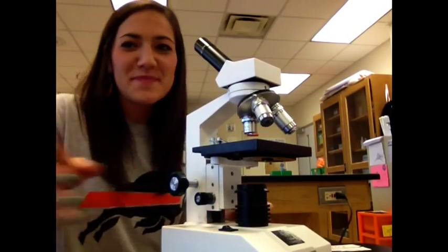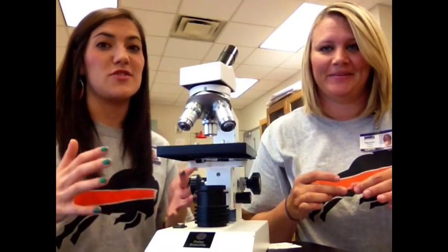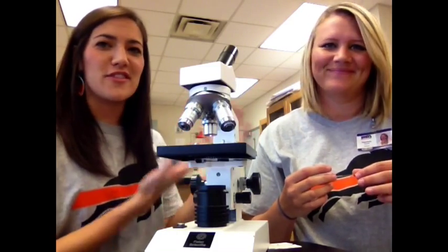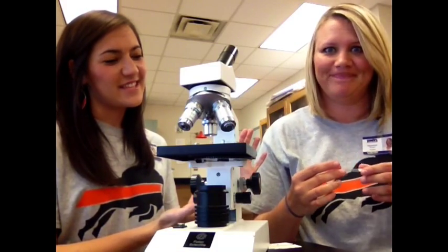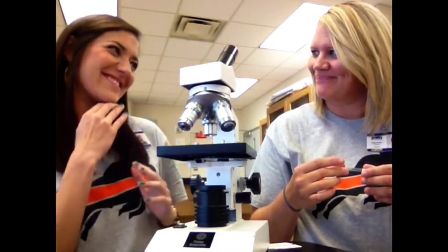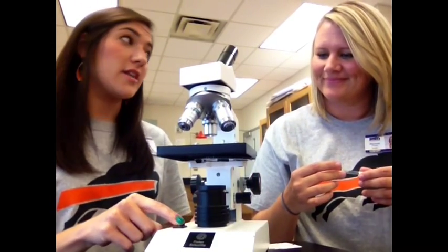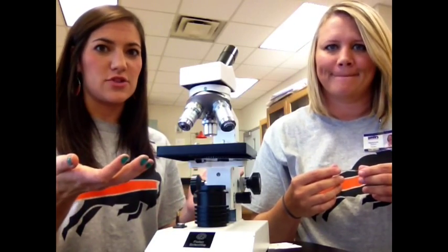Sometimes it changes. Okay, for our last section, we need to talk about how to actually use a microscope. And for this, I brought in the wonderful, the lovely Coach Fears. Coach Fears is going to do the steps of setting up a microscope as I describe it. So, first things first, you have to turn the microscope on, which I've already done for Coach Fears, so that the light can actually shine and you can actually see what you're doing.